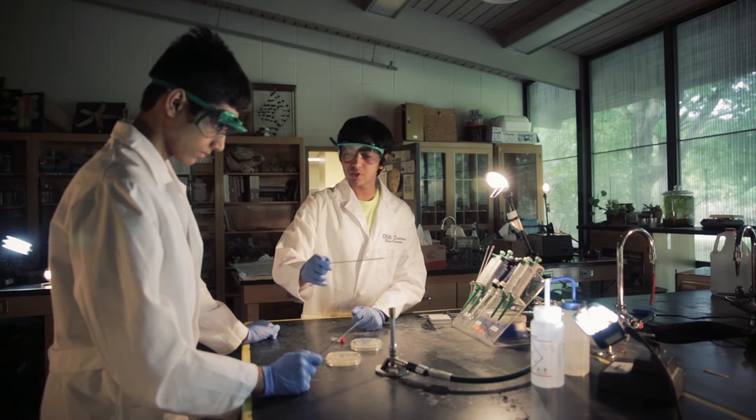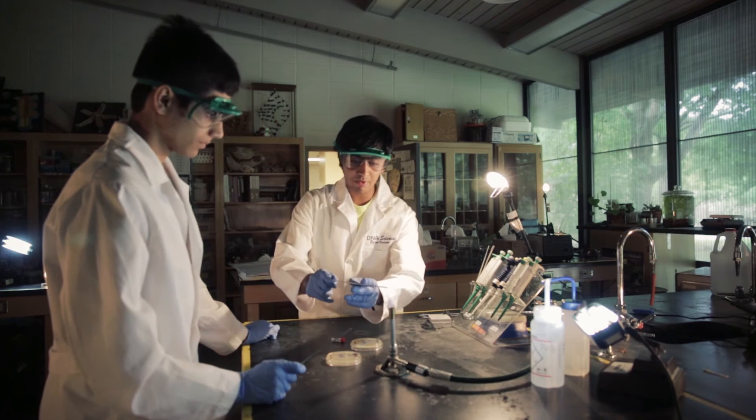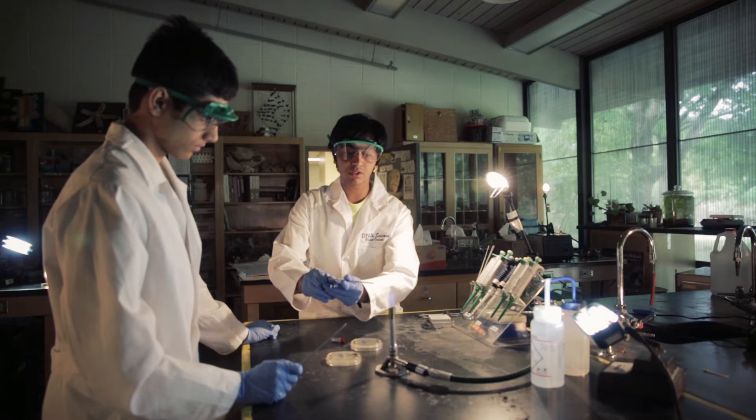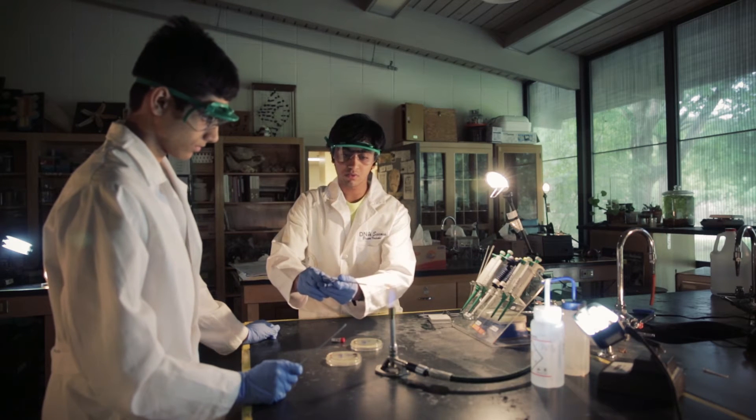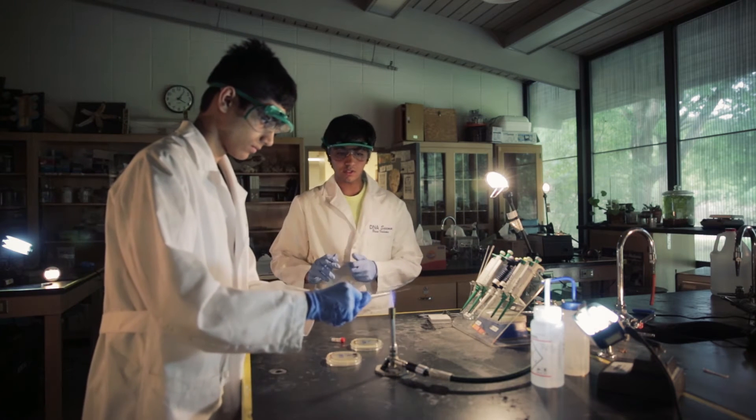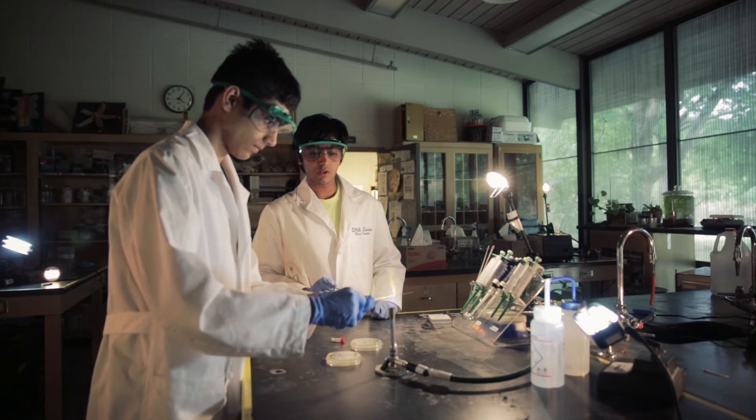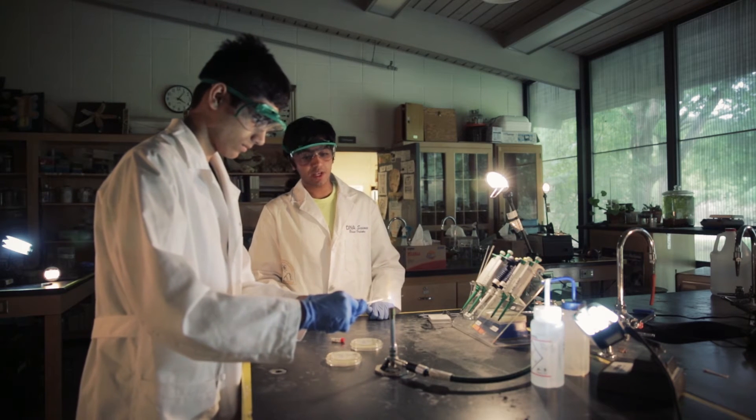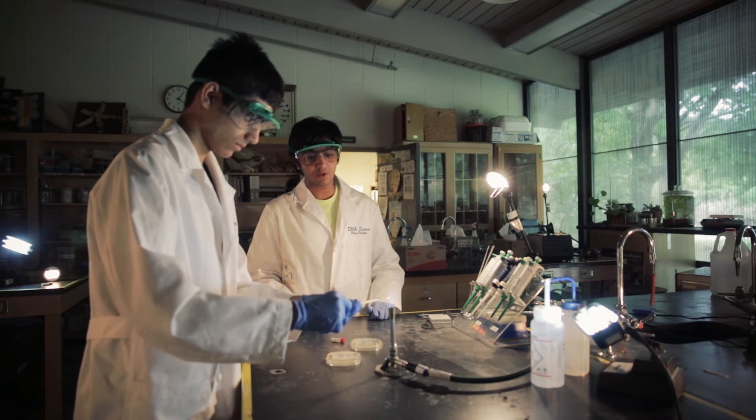So we have to put it, hold on a second. We have to start with the back and put it right above the blue cone, which is the hottest part of the flame, and slowly take it to the front. Right on the hottest part. So this is going to make sure that any contaminants will be exterminated here.